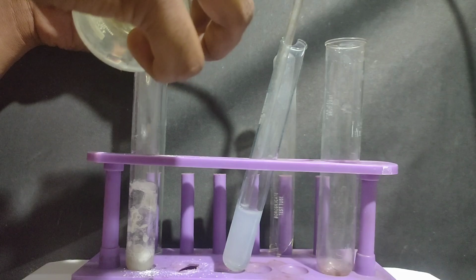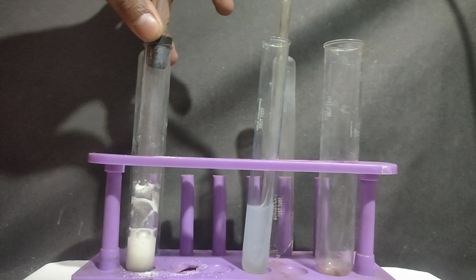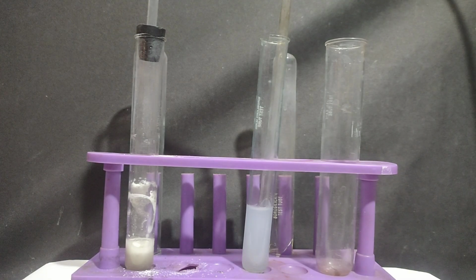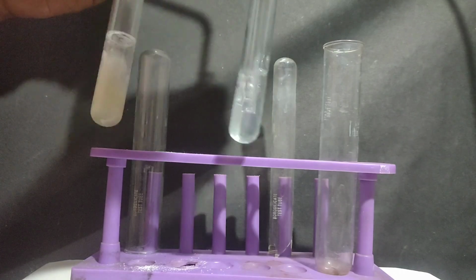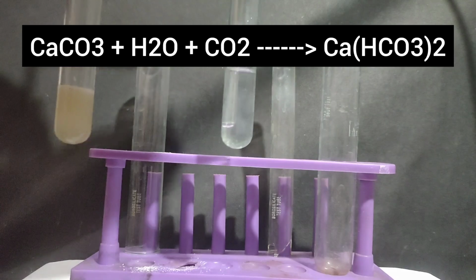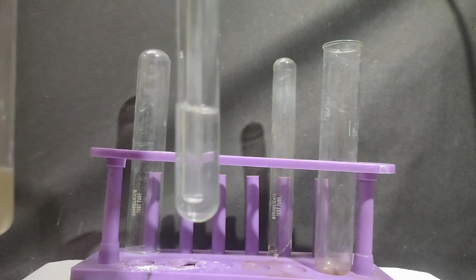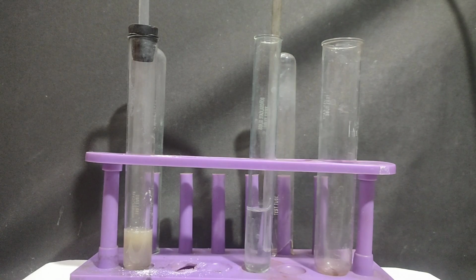On passing excess of carbon dioxide, this lime water will again turn colorless. You can observe that the milkiness is now disappearing. And see, now it has again become colorless or clear. So by this test you are confirmed that carbonate is present. One thing I have to tell you is that soda extract is not prepared in the case of carbonate.